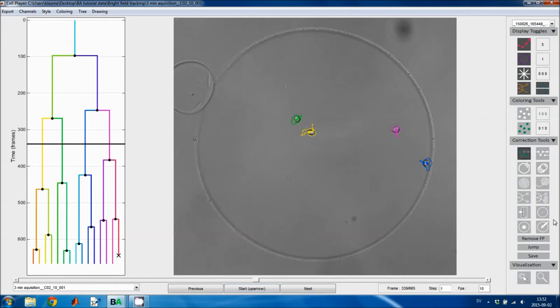You can use the magnifying glass to zoom into the lineage tree, but if you have it selected, you can't move between frames by clicking in the lineage tree. We'll just watch this and see where tracking mistakes occur. I actually know that there aren't any tracking mistakes until about here, where a cell divides.